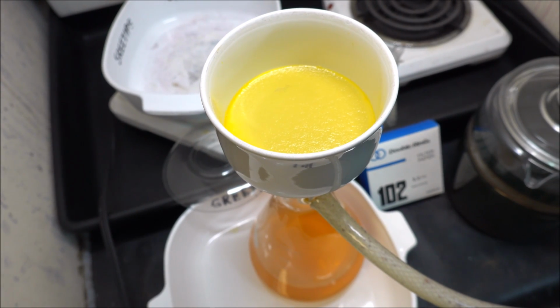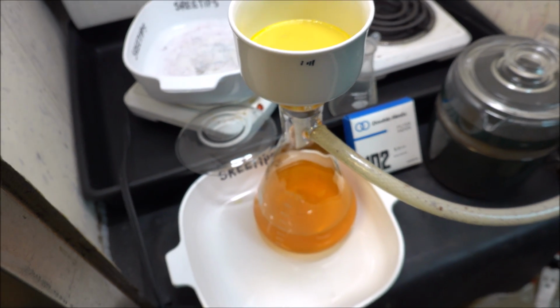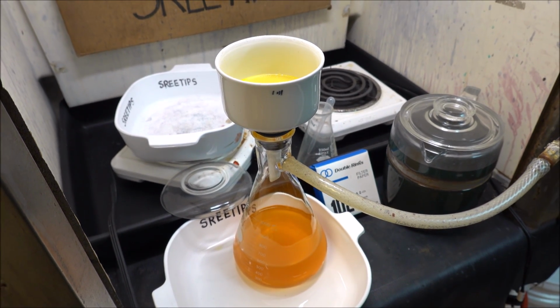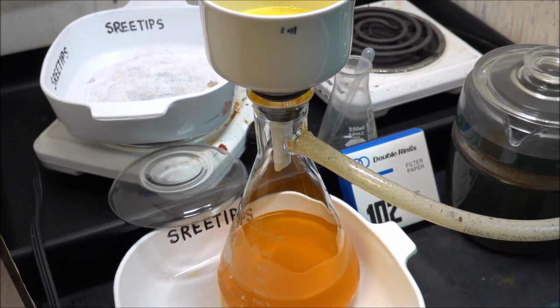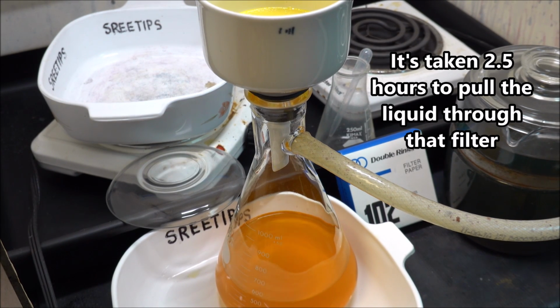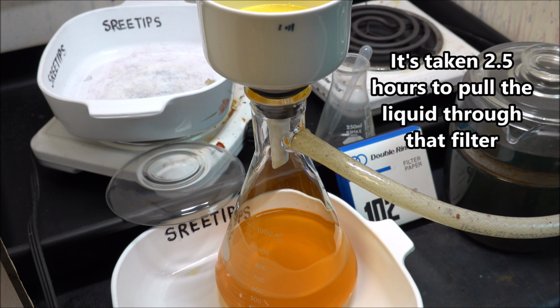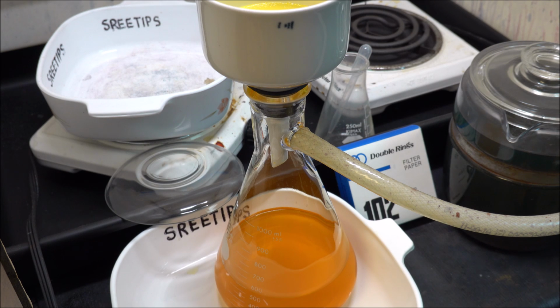I'm finally down to the solid material there in the funnel. It's been filtering for 2.5 hours now. And as you can see, I'm still just getting a few drips. About one drip every 15 or 20 seconds or so. And I've still got to rinse the funnel out and get all that liquid forced through it. So this is why we want to avoid having a whole bunch of silver chloride in with our gold. It slows the filtering way down.